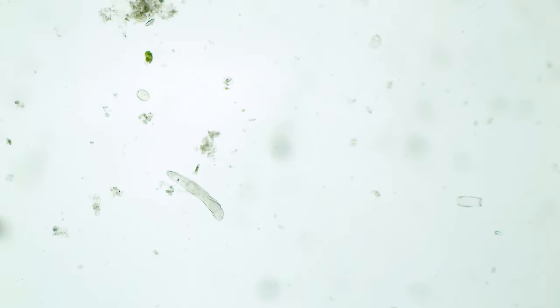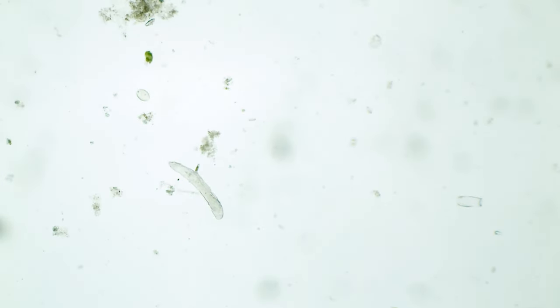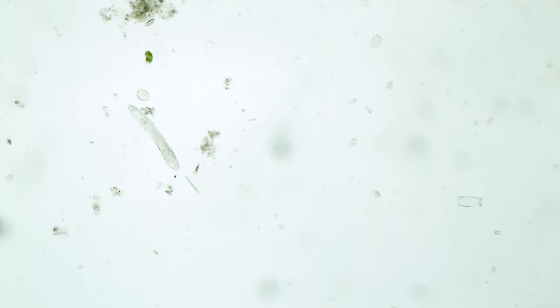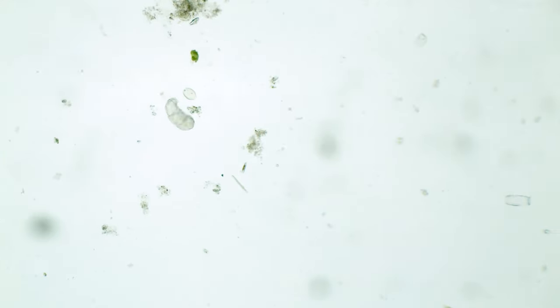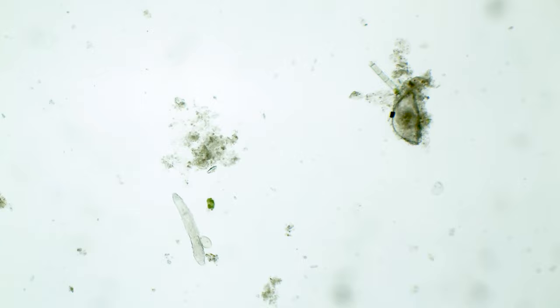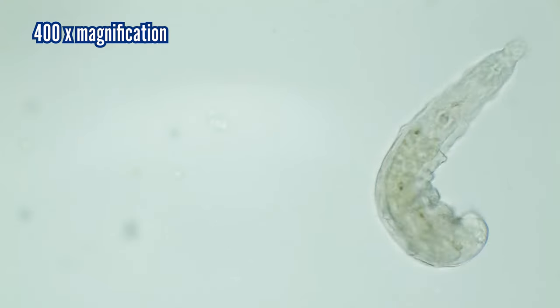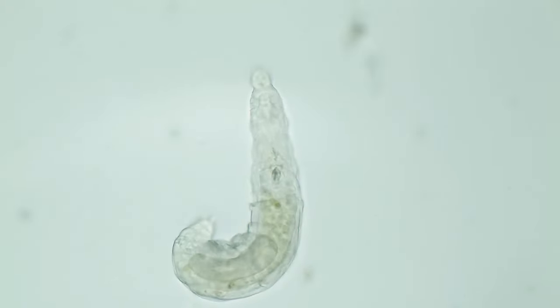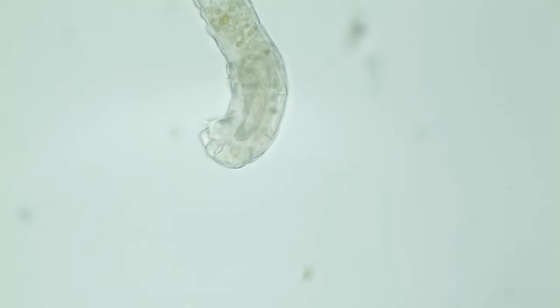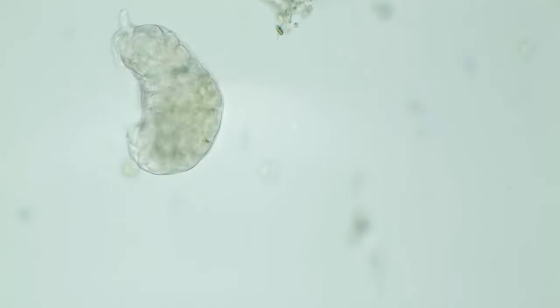And there is not only one — I was able to find around 10 of them while searching under the microscope. So let's take a closer look. Its movement technique is actually really impressive. These creatures are transparent, so we can see right into their guts.